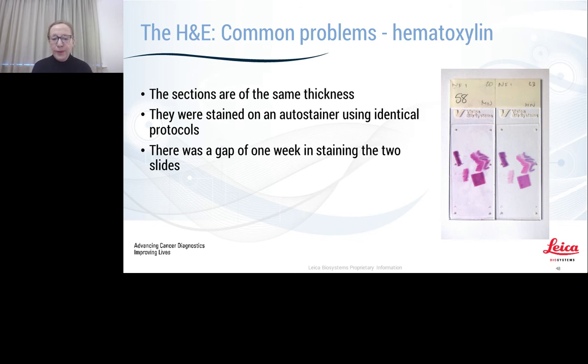So, some common problems. These are two control slides, so cut the sections of the same thickness. They were stained on an autostainer using identical protocols, but there was a gap of 1 week between the staining of the two slides. And this is where your scoring can come into it, but a quick glance can show you that there's a very big difference because the stains have gone off over the week.